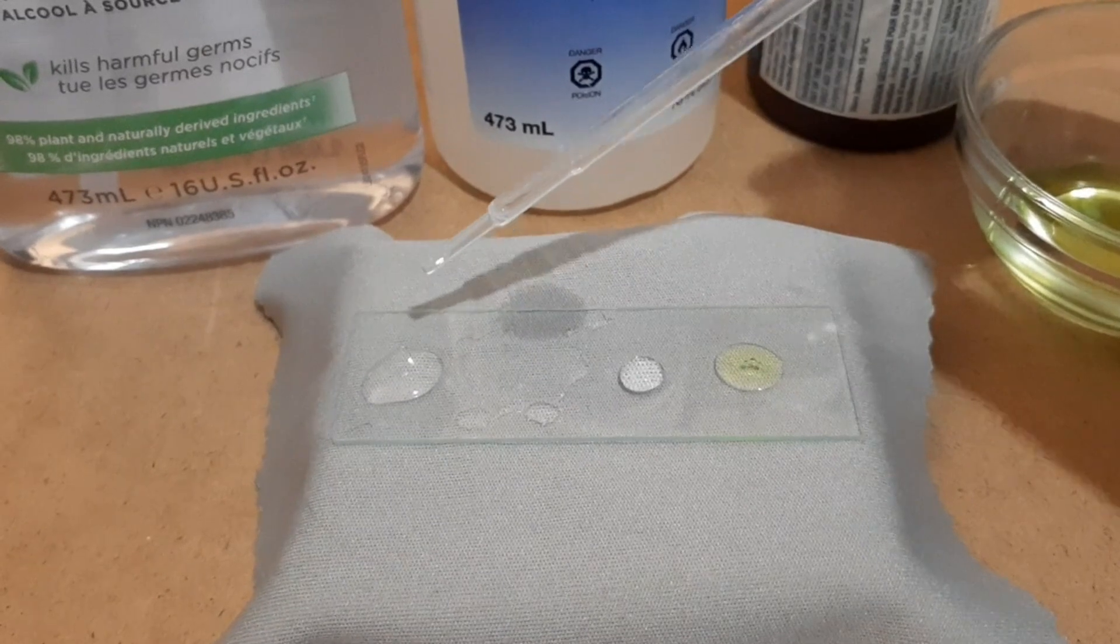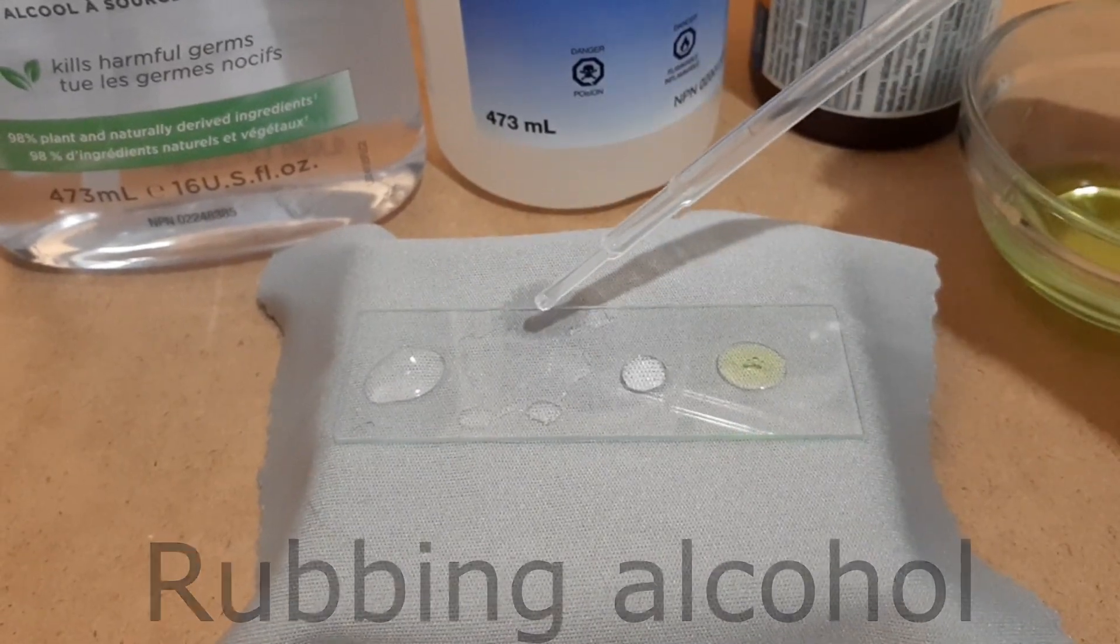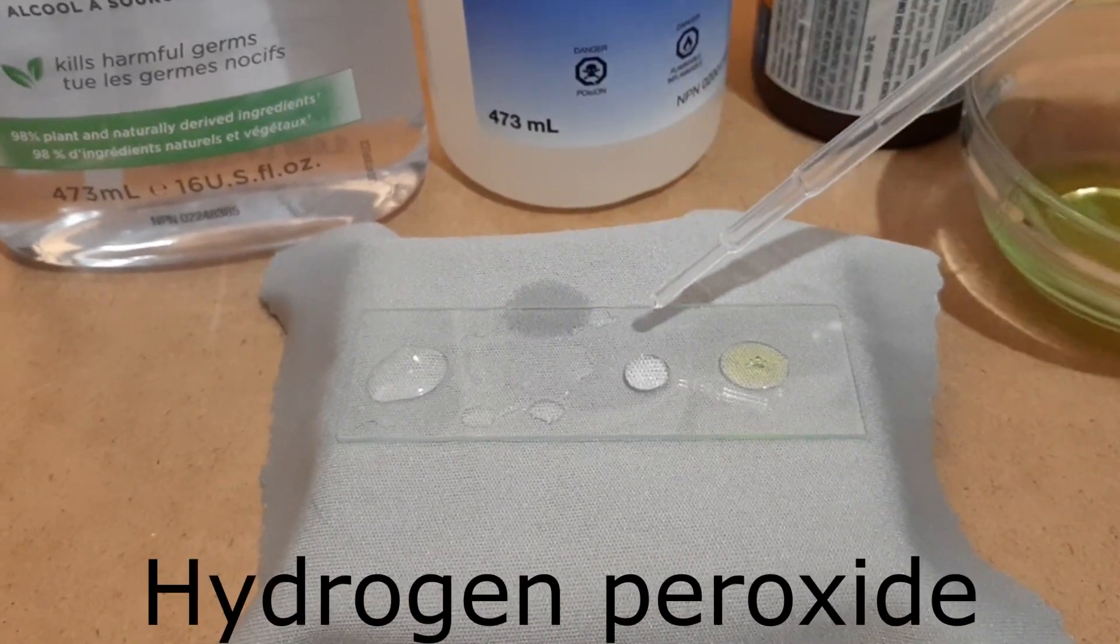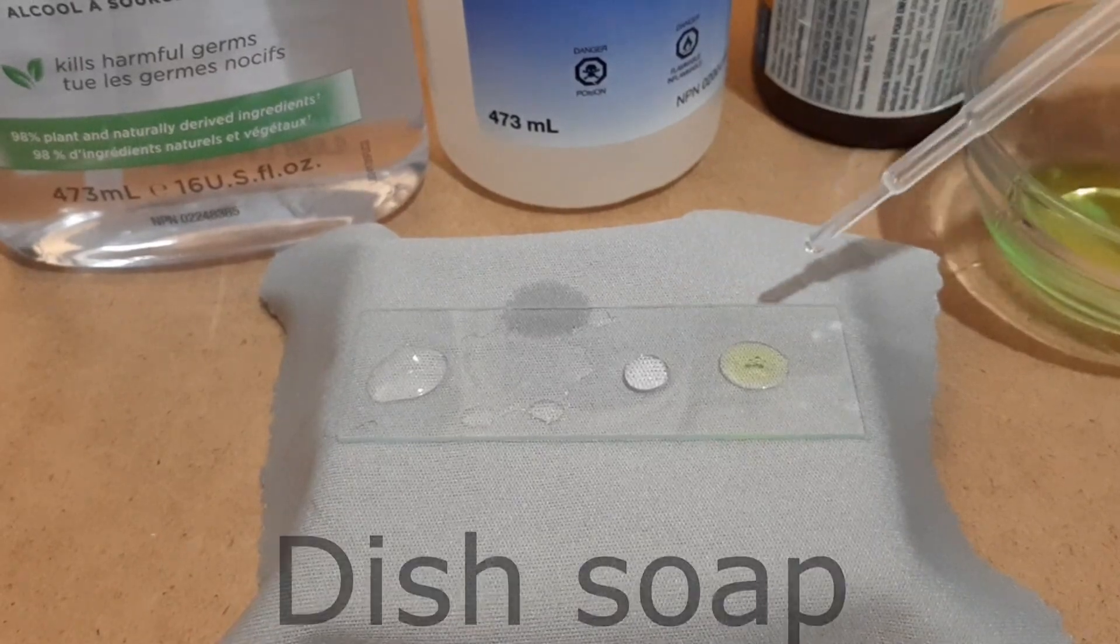Hand sanitizer, rubbing alcohol, hydrogen peroxide, and dish soap.